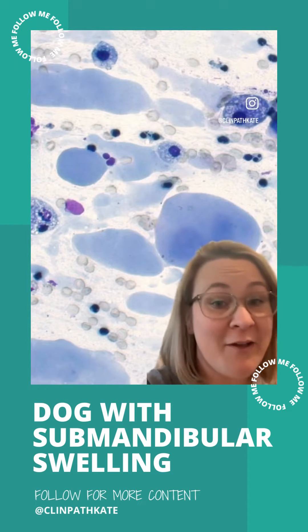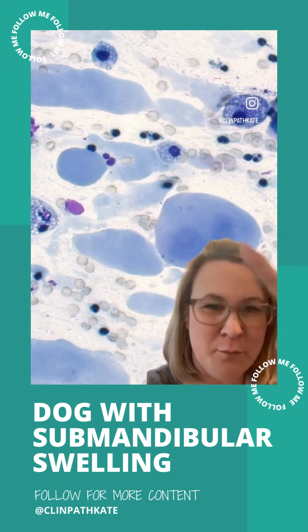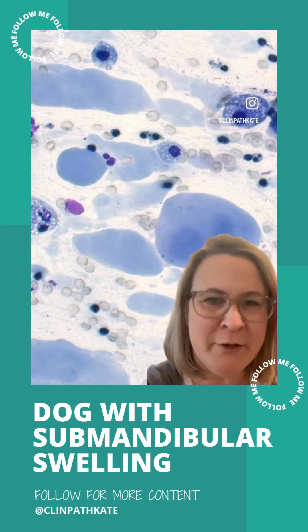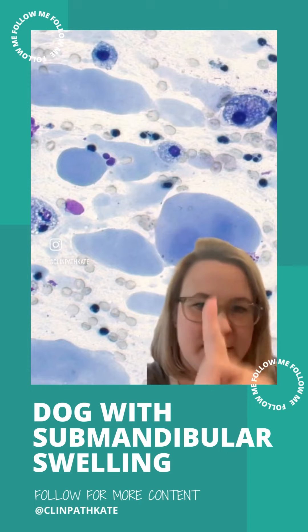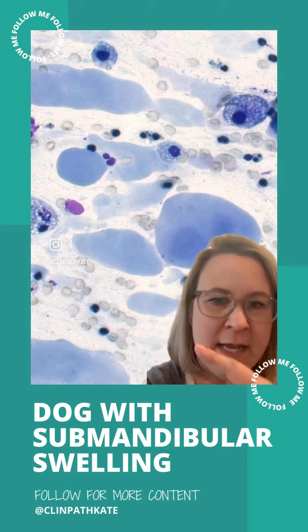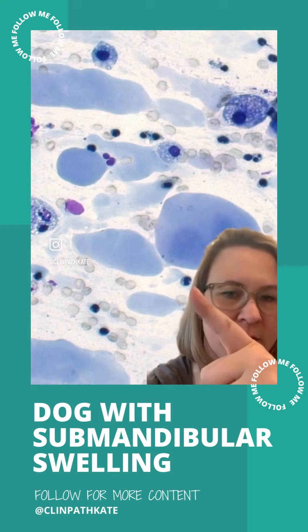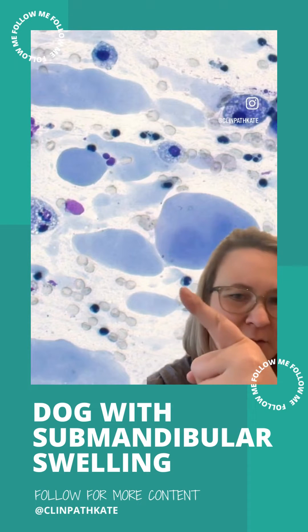There's a lot going on in this sample, but hopefully right away you can see that there are these pools of this blue amorphous material. There's also inflammatory cells — we've got macrophages that have vacuoles, and we've got some neutrophils here too. They're hard to see at this objective, but those are neutrophils.